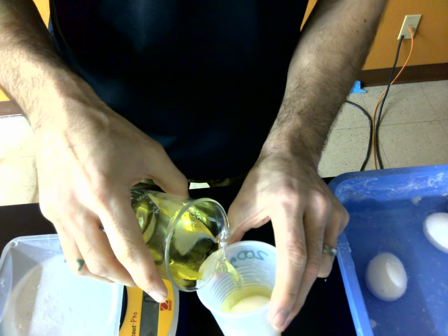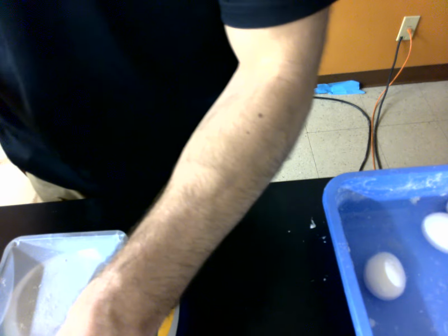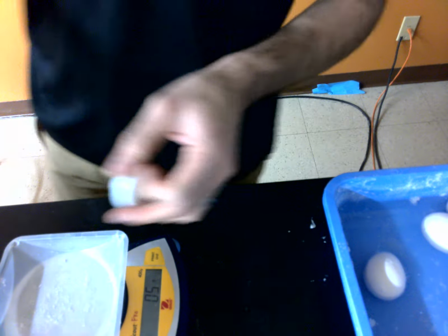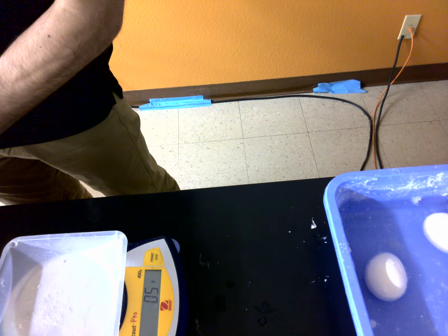Let's go here. That's kind of a big guy, but yep, it works. Fills it. Now the 400 gram per liter solution. Remember, that's a concentration.